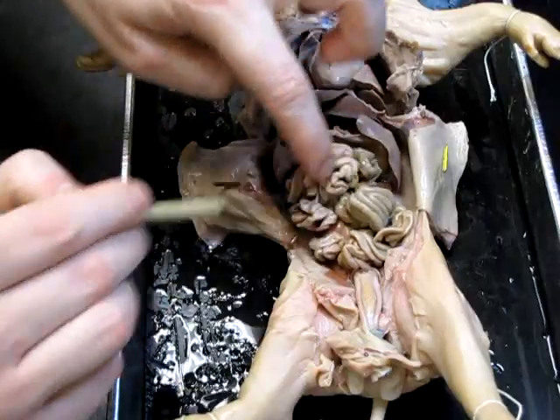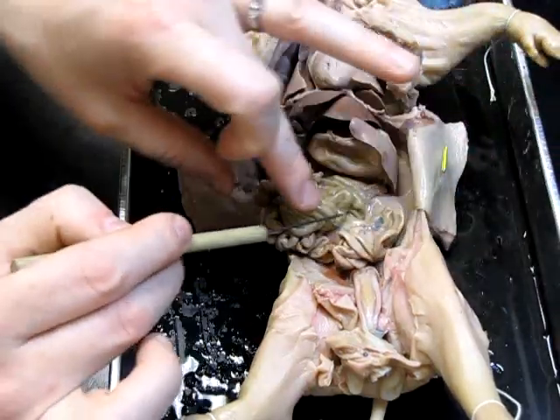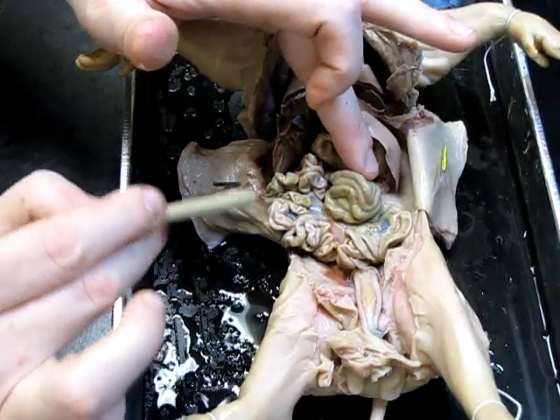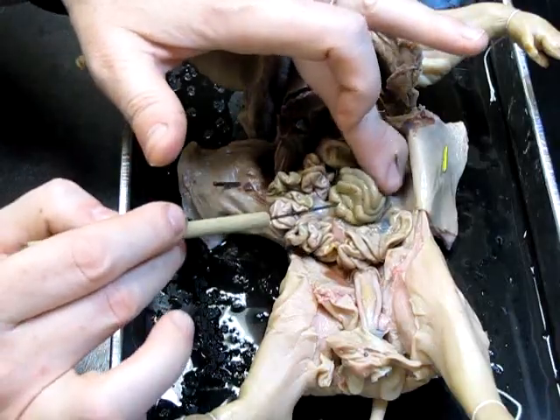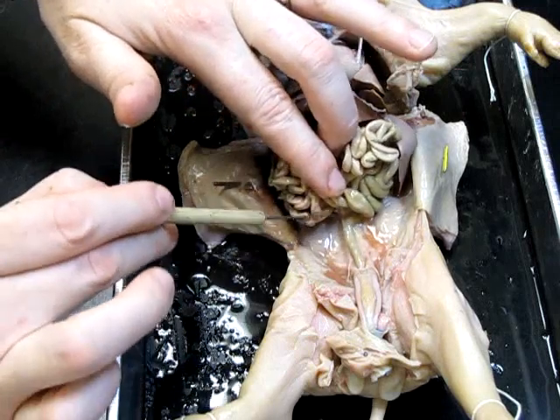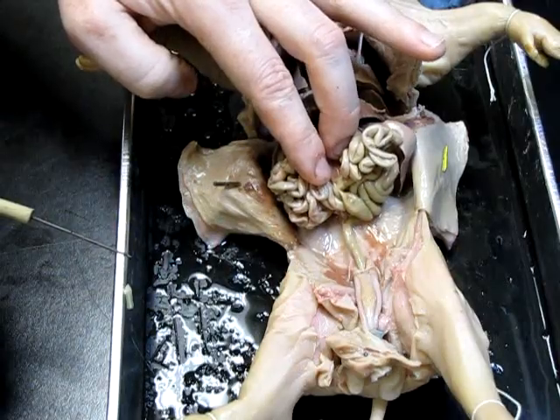Following along we have the small intestine, and then we find this other coil of intestine which seems to be in its own sack of peritoneum — and it is — and this is the large intestine. It's a little bit of a different looking structure. We follow that down, and eventually we would get to the colon and then to the rectum, and then feces would be ejected out the anus at the end.